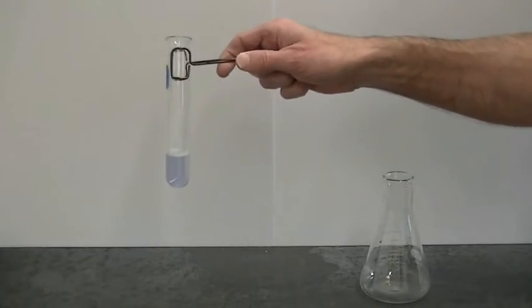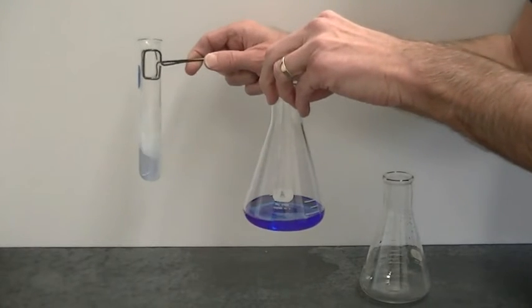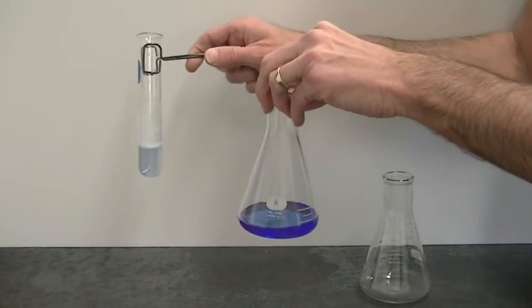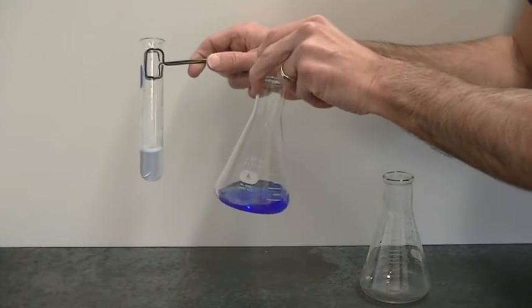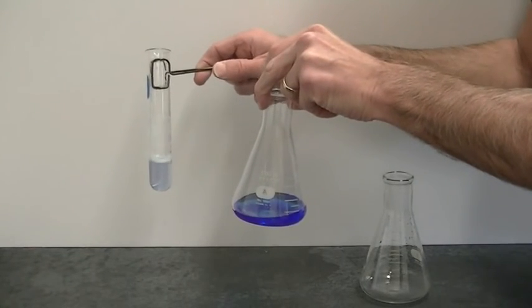Let's compare the color of our heated solution to the original. The faded color is indicative of the fact that the protein has been denatured.